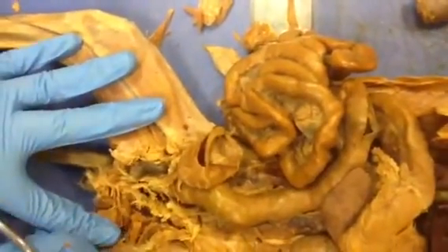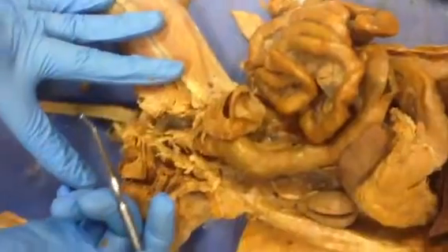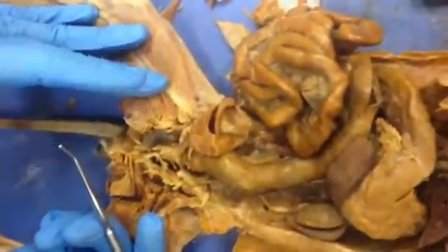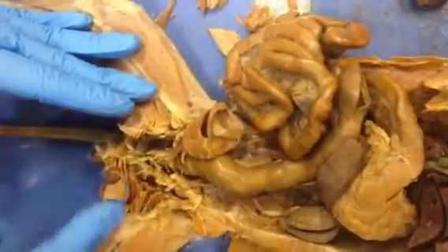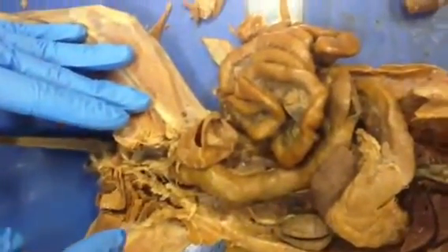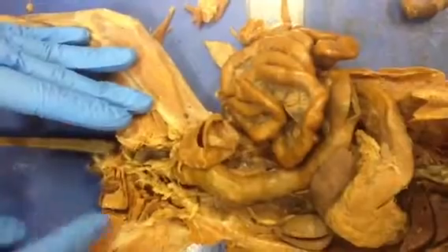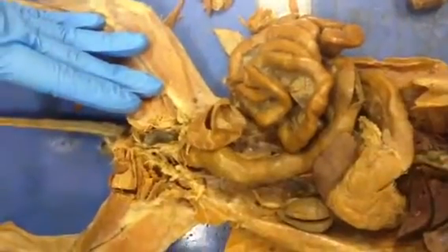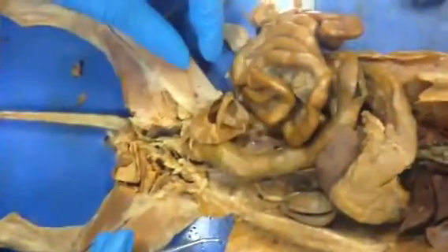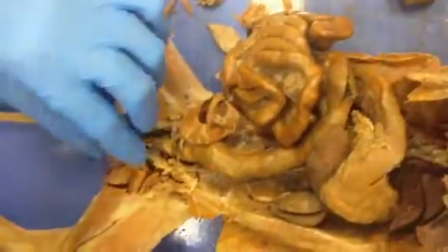However, in the female cats, there's a urogenital sinus, which is a common opening of the urine and the vagina of the cat. They have a common shared opening, in the female cats only, not in humans, obviously. We don't have a female cat, but still, you should know.